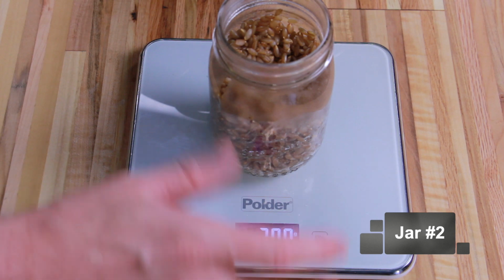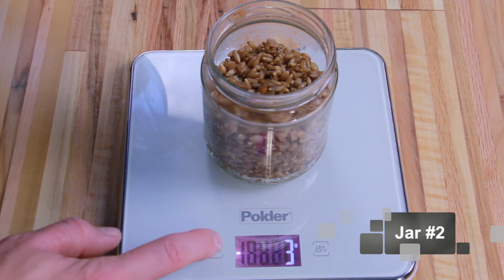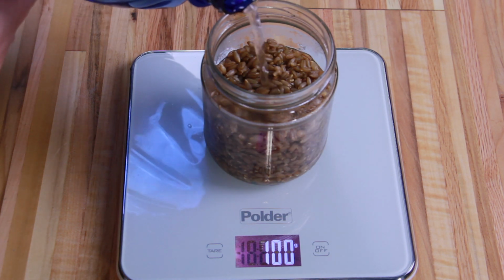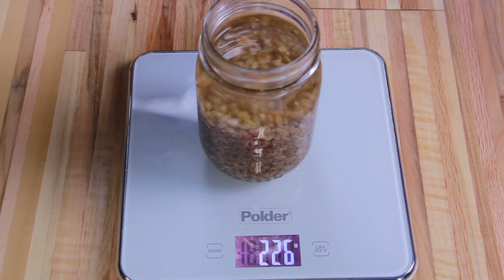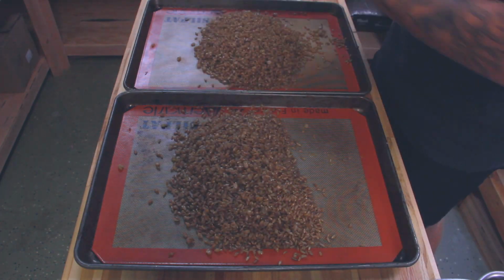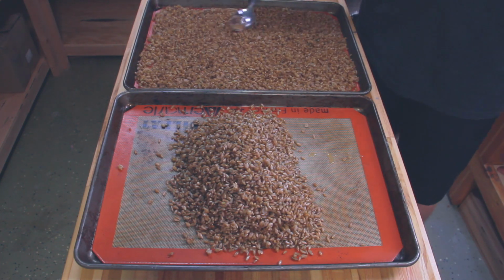For the 2 jars that I'm lacto fermenting, I put 200 grams of the soaked and boiled rye grain into the jars, and then filled the jars with tap water. I'm going almost all the way to the top here, just right up to the rim. For the rest of the grain, that's going into the boil-only jars and the 2 control jars.